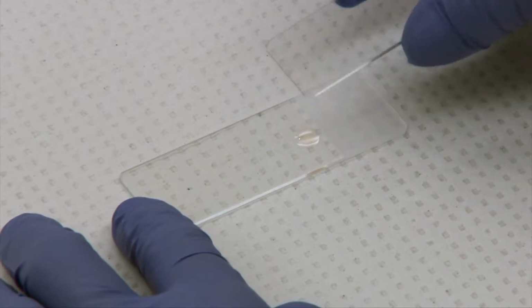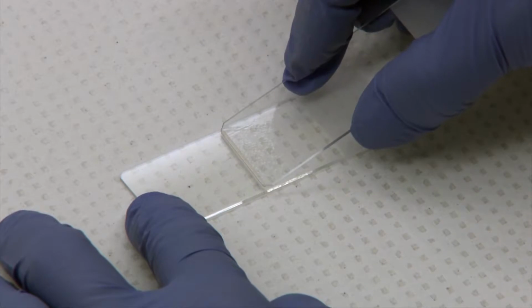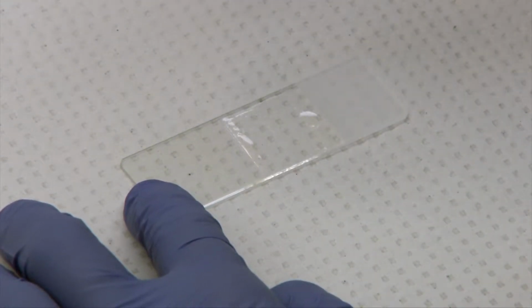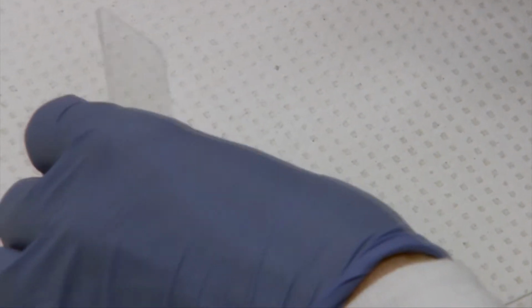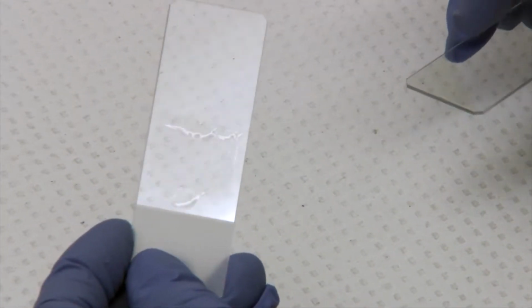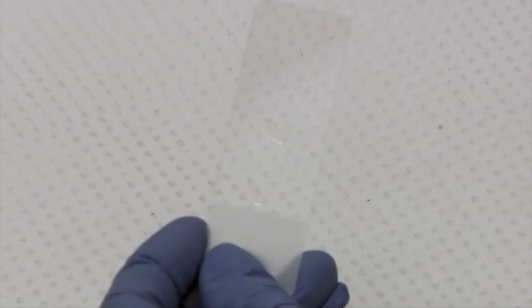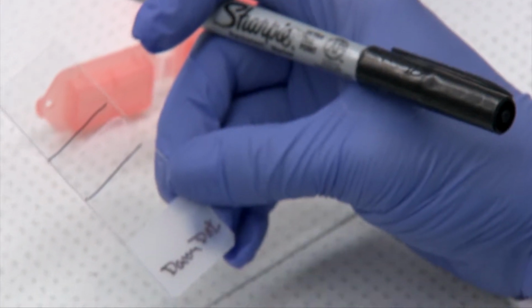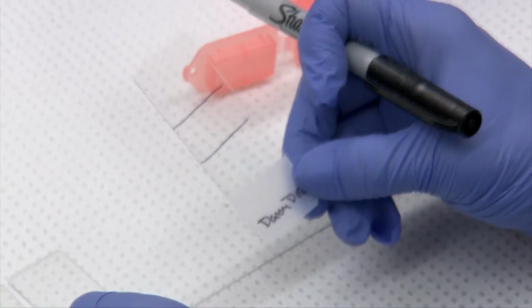So this is demonstrating the line preparation, which can be used to concentrate cells. And you start out like a blood smear, and you just lift it straight up after going about halfway down your slide. And then you will see that you have a line. It's really handy if you just indicate on the back with either a marker or a grease pencil where your line is, because sometimes in non-cellular fluids it's quite an effort to find that line.